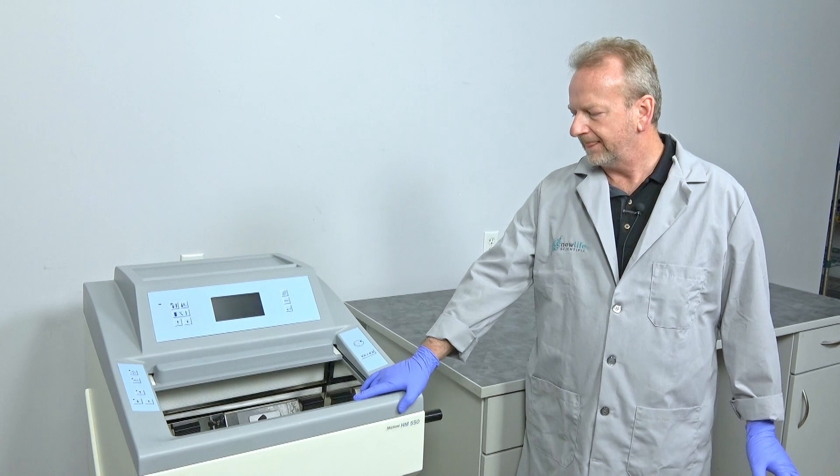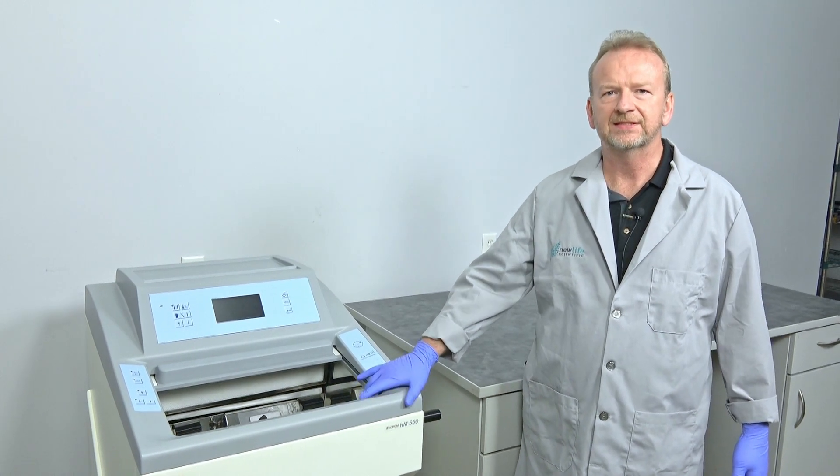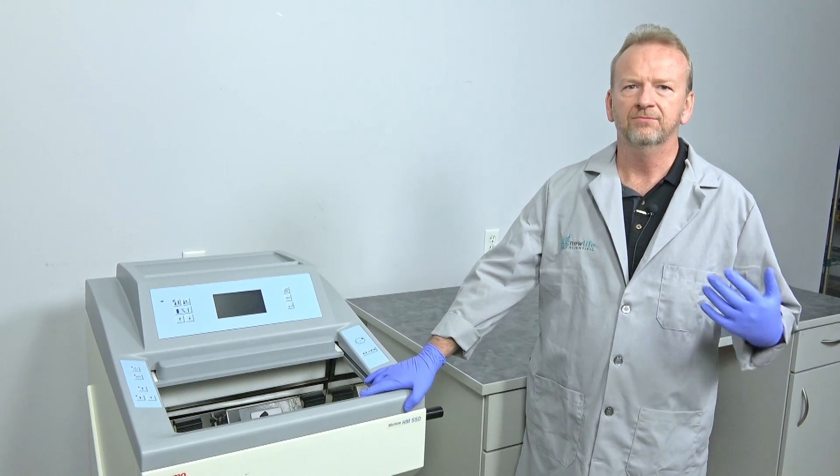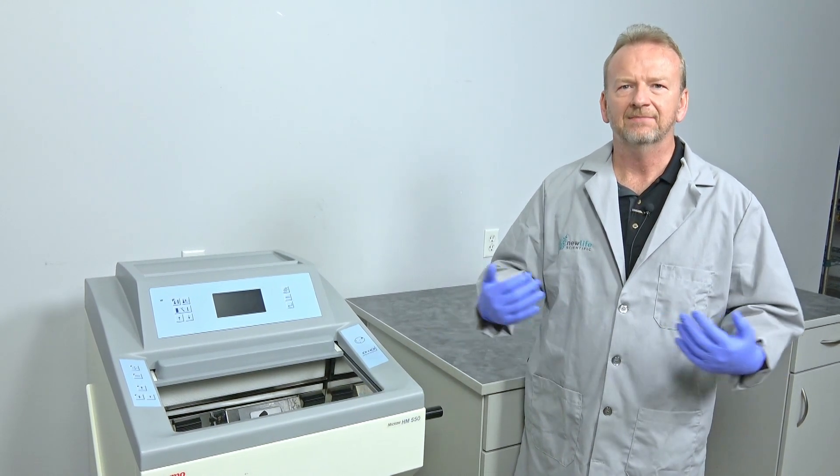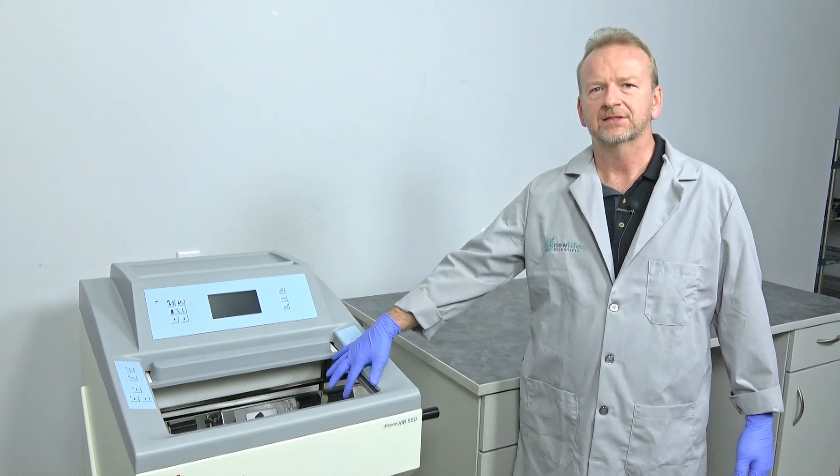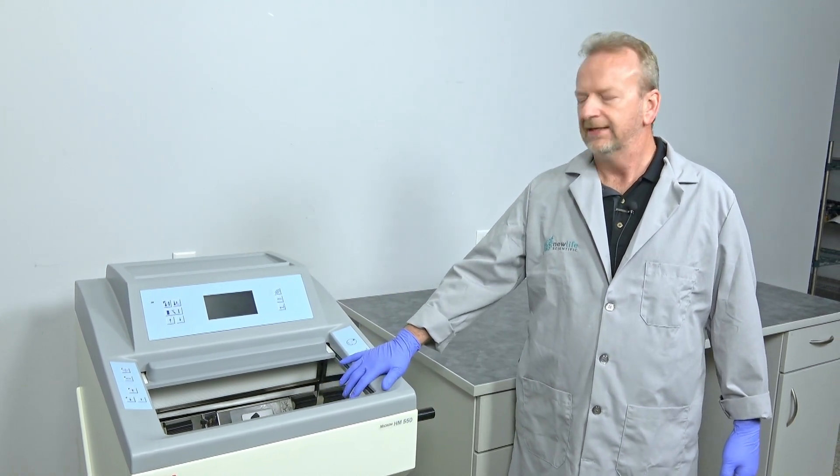Sometimes in the past we shipped these out and during shipping with temperature, humidity, cold, and heat mixing, there's a lot of humidity or moisture that gets built up in the chamber.